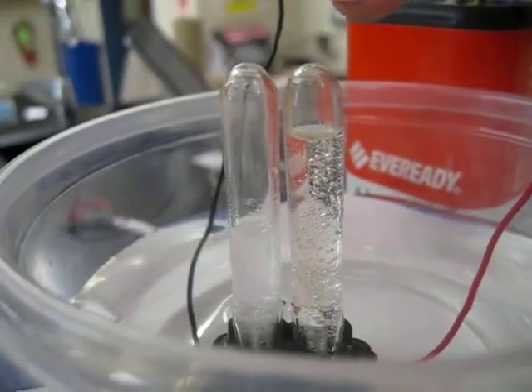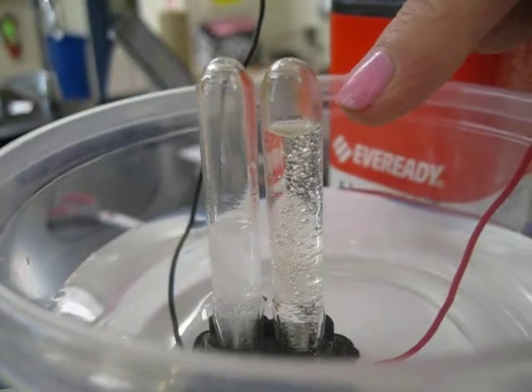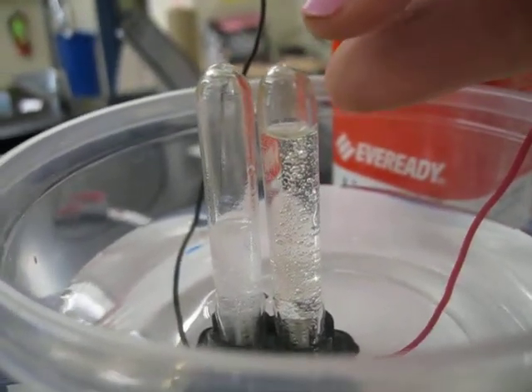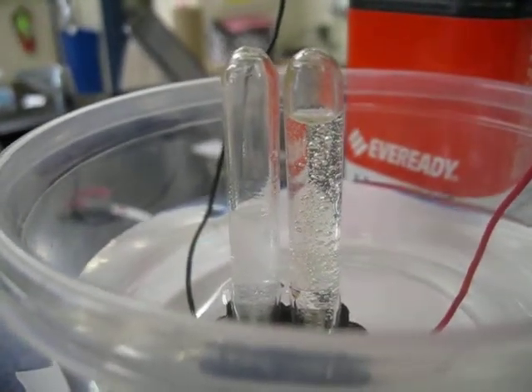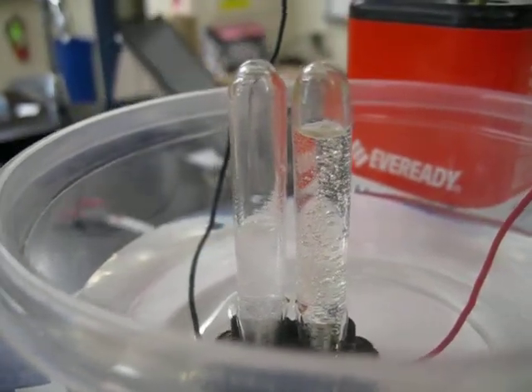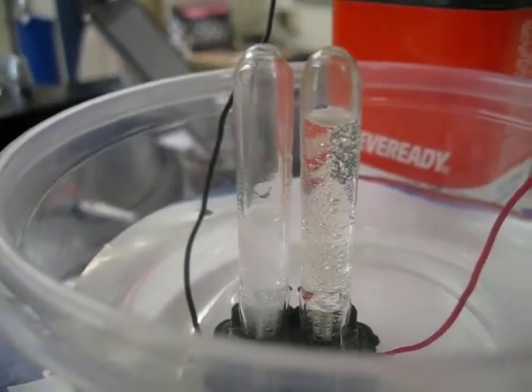And if you look at this one, there's a much higher level of water still remaining in the tube with just a minimal amount of space being occupied by something else. And again, you want to think about your formula, what could be taking the place of where the water used to be.